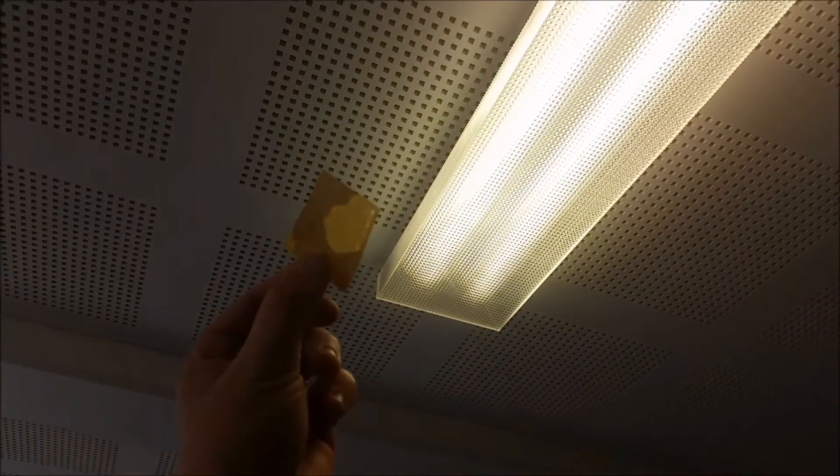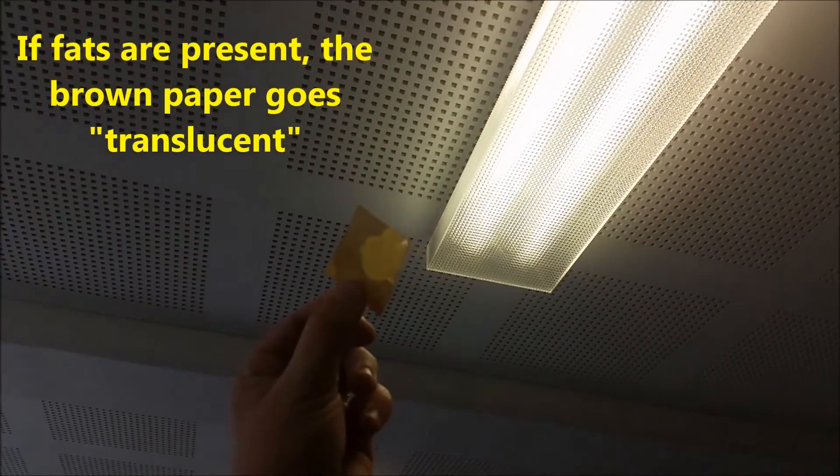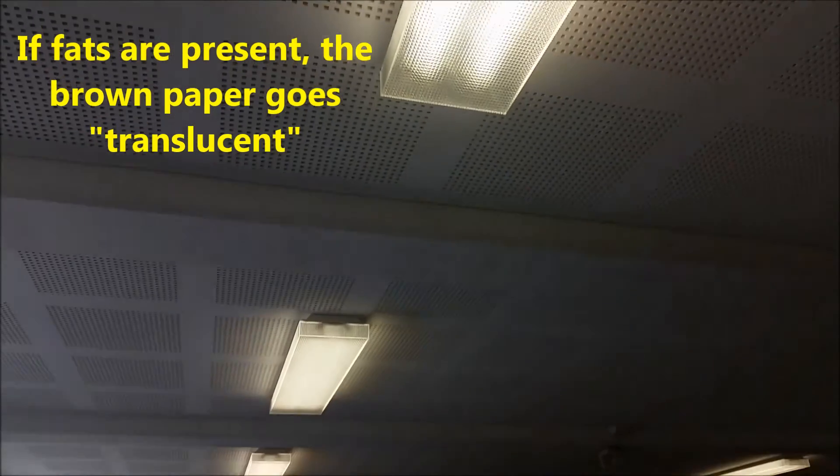So I will show you guys in a moment, but what happens is the brown paper goes translucent. You can start to see through it.